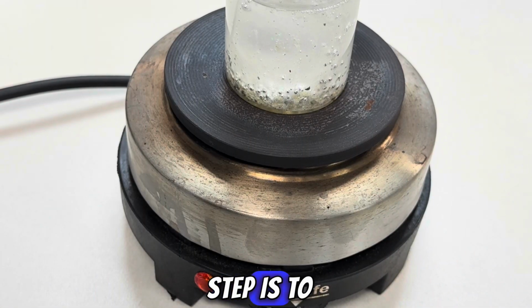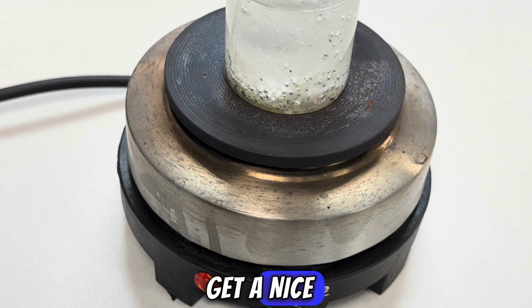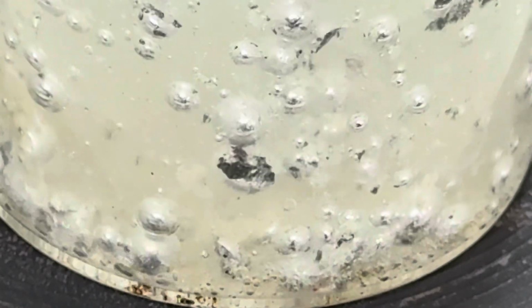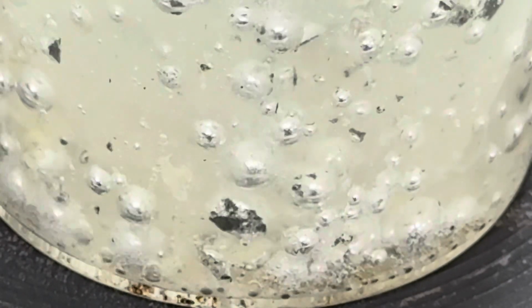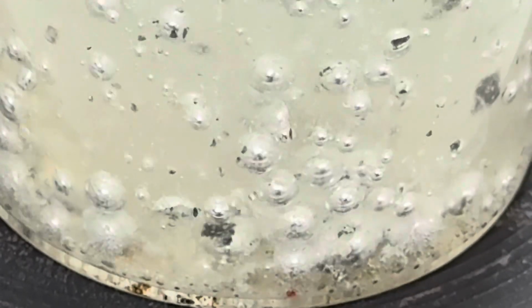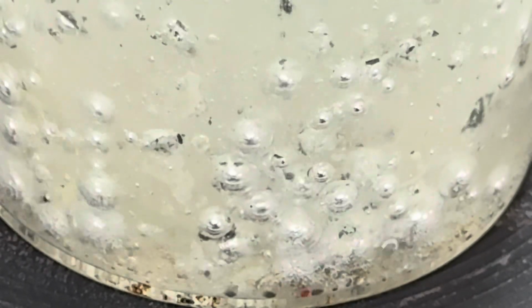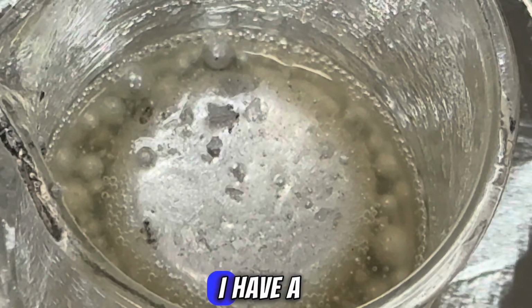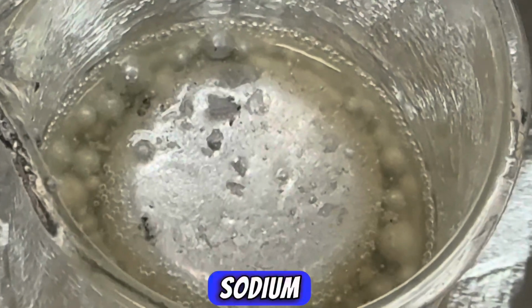The first step is to heat up the NaK so you get a nice, even ball of sodium-potassium alloy. After decanting some of that mineral oil off the top, you can see I have a nice blob of sodium-potassium alloy.